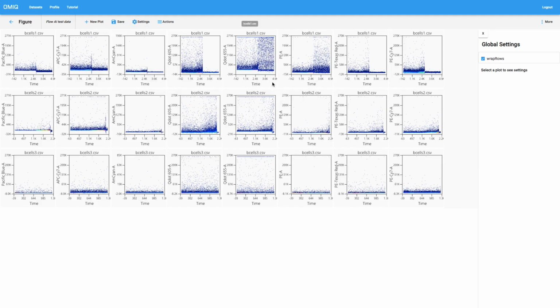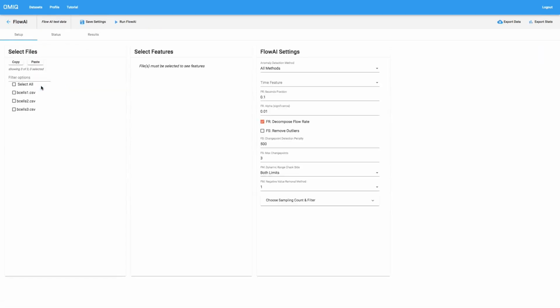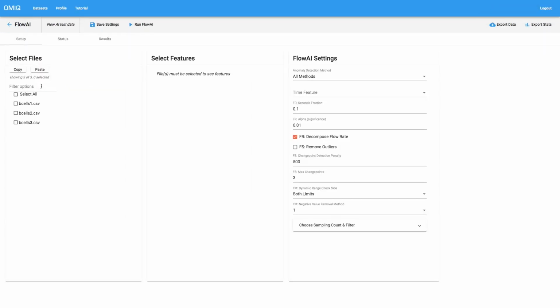So these are the types of things that we don't want to make it into our analysis, and the types of anomalies that Flow AI is designed to detect. So without further ado, we will learn how to configure our Flow AI task. When we open up Flow AI, the first thing that we'll want to choose is our files. And so in this case, we're going to choose all three files to include in the analysis.